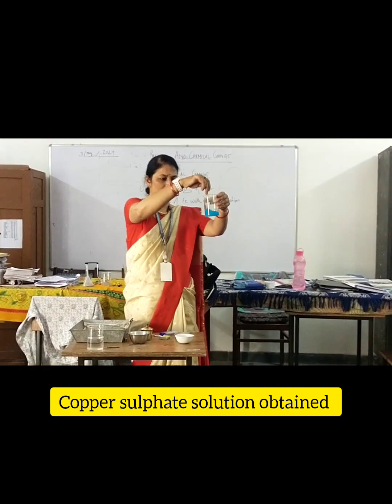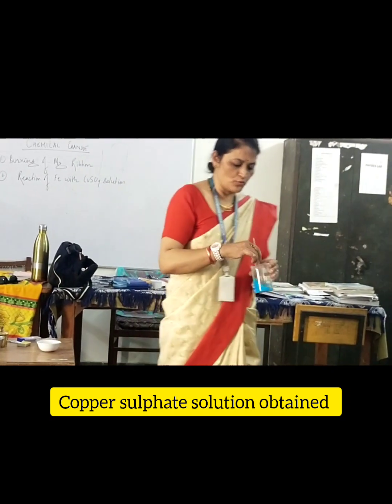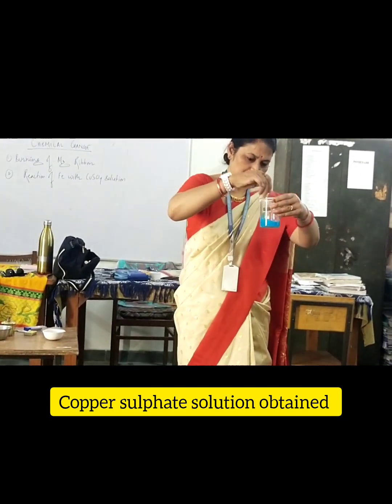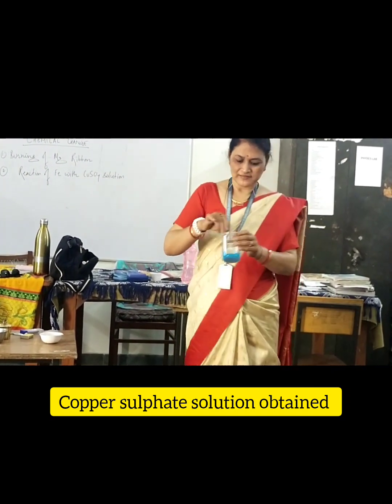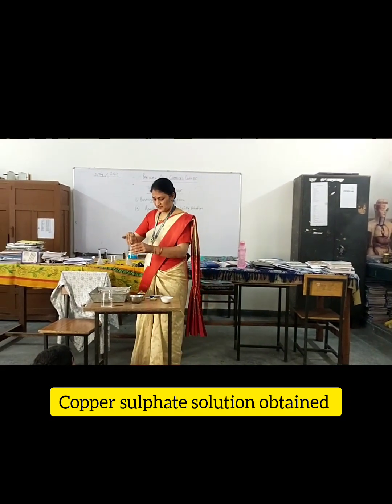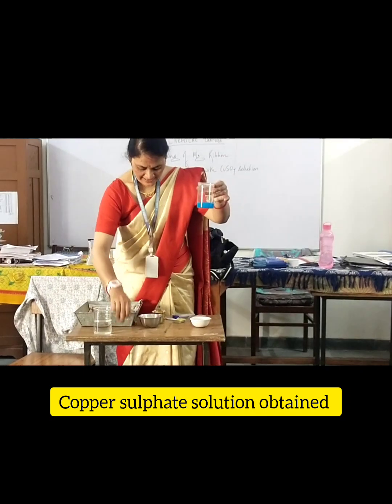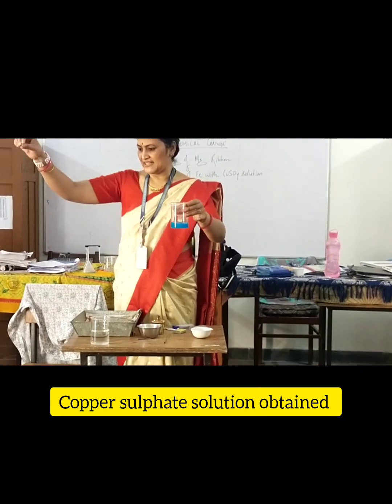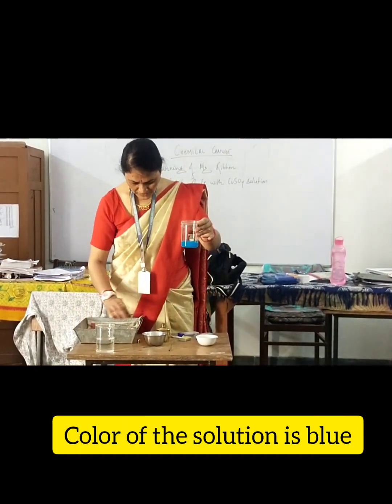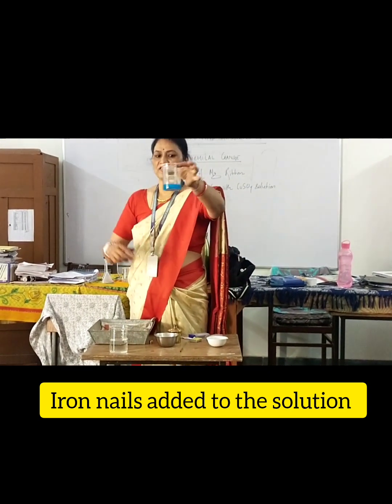See what is the colour of the copper sulfate solution? Blue. The solution colour is blue. Now I will take an iron nail — I have one more. So I will put both the iron nails into this.